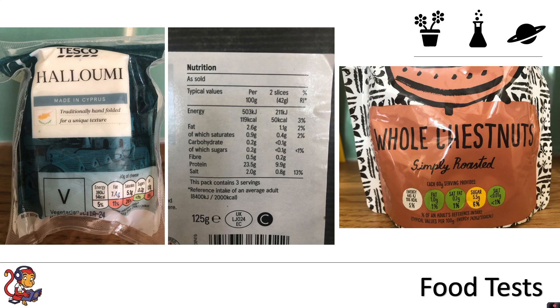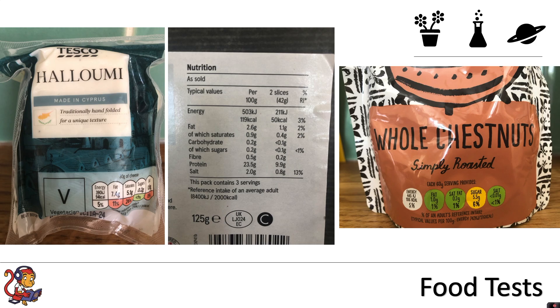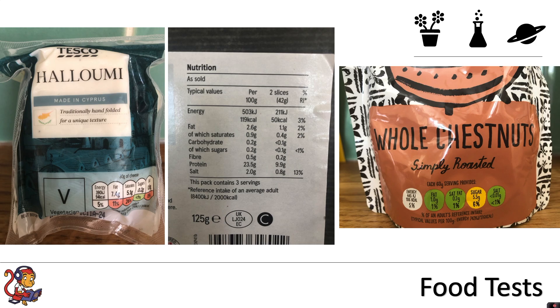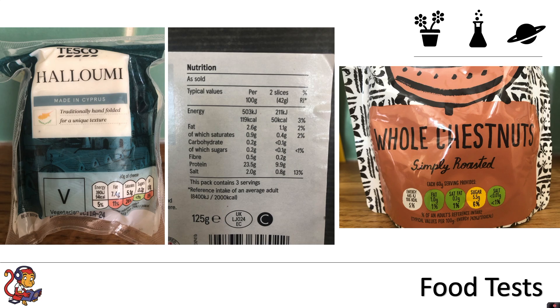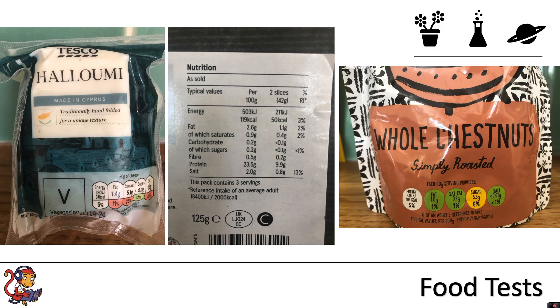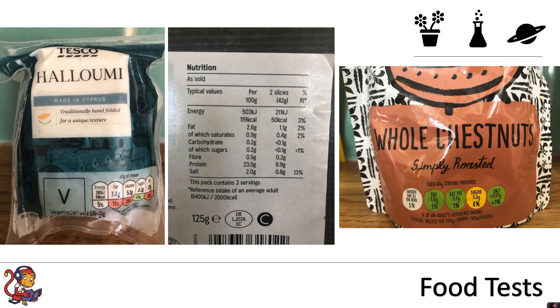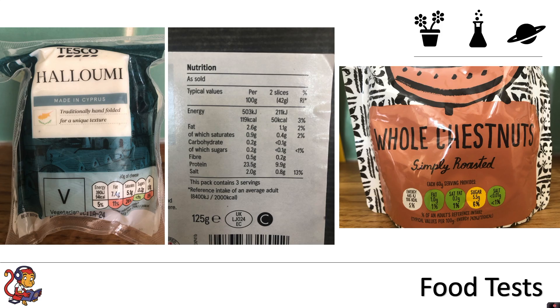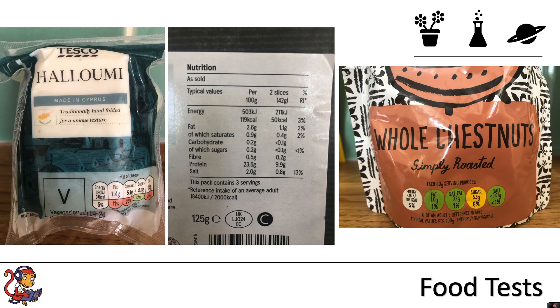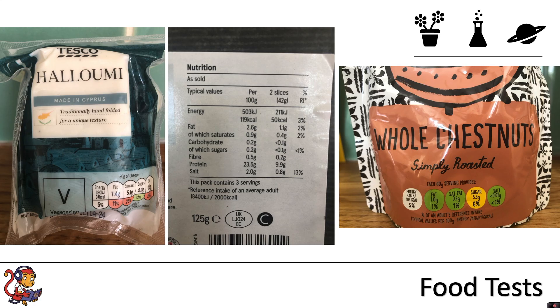If you look at food packaging you will notice that it gives information about all the nutrients that are in the food. In this video we are going to look at how scientists use food tests to work out what nutrients are present in food.